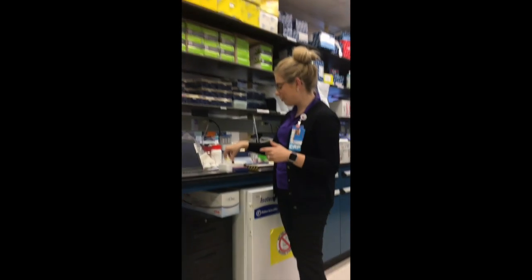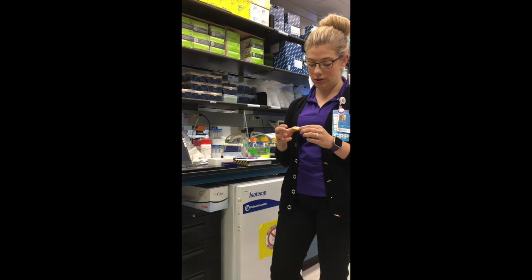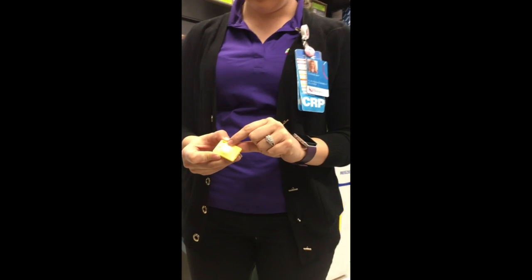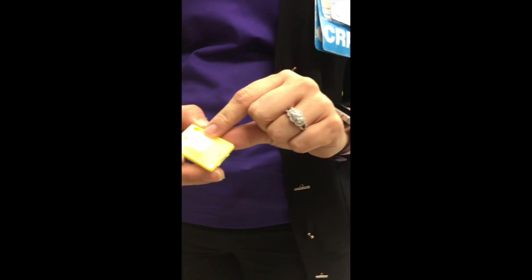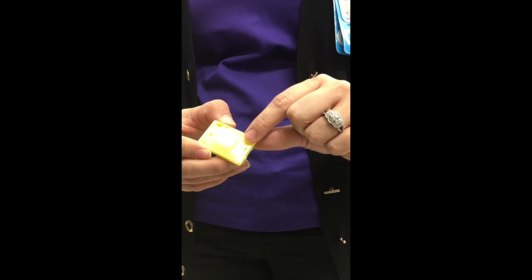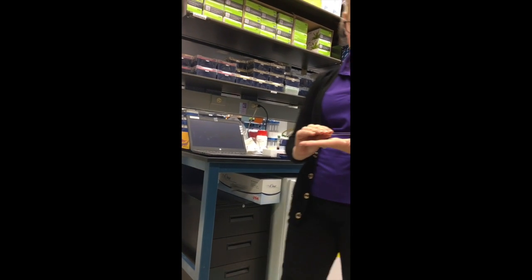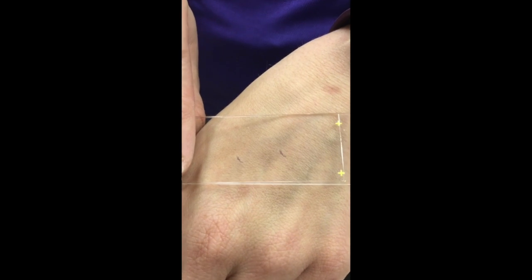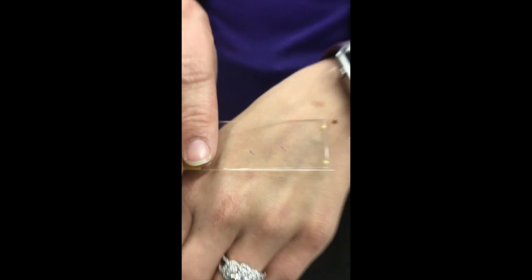And then what they do in pathology, which is one of the reasons you get a scope, is they put it in wax and they cut it and they put it on a slide. So there it is in wax. There's a biopsy. You can see it. This one's already been cut, so it's a little easier to see, right? And then we put it on a slide and we stain it. So there's two pieces that have been cut and stained. And then they look under a microscope, which we're going to look at a little later. We've got some slides to look at. I'm going to show you.